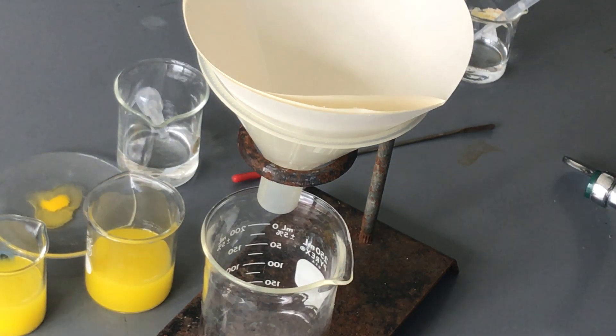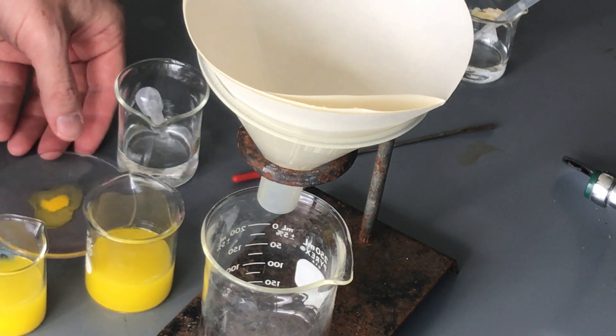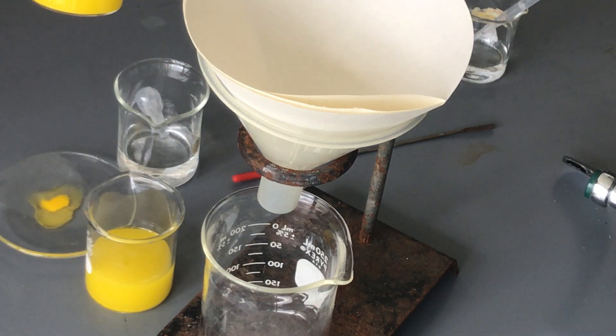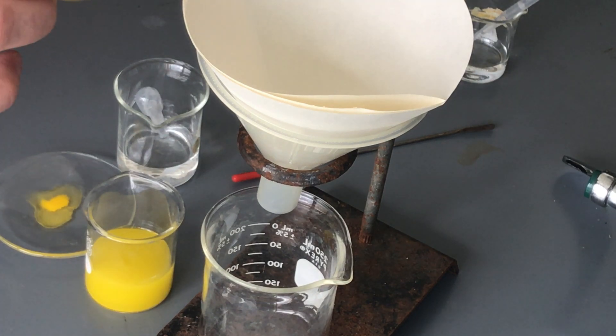So you're gonna hear me, it might sound a little bit differently as I switch. And so I have this material, it's a solid precipitate and we don't want to just dump it down the drain. But I also don't want to just let it sit here forever because if I let it sit for a while it will settle down to the bottom. We have again a solid product, it's heavy and it will settle out over time.